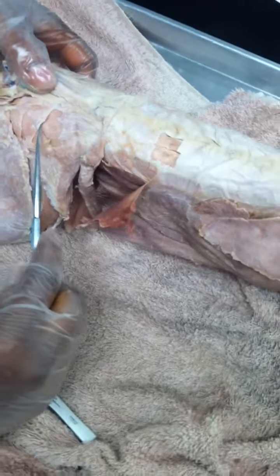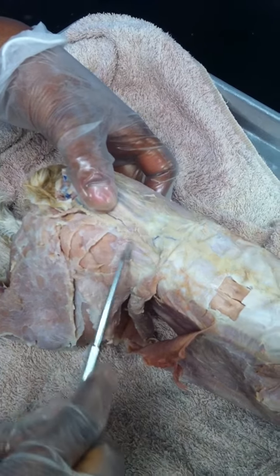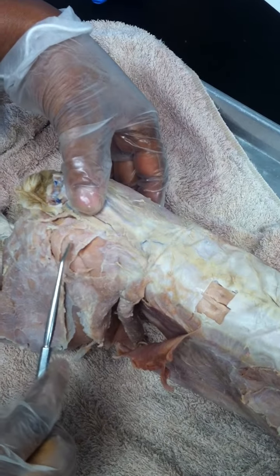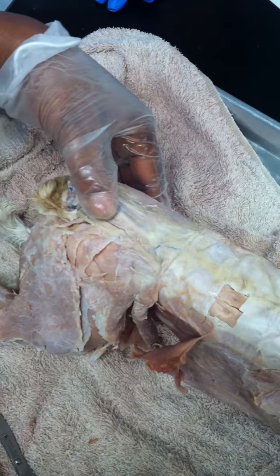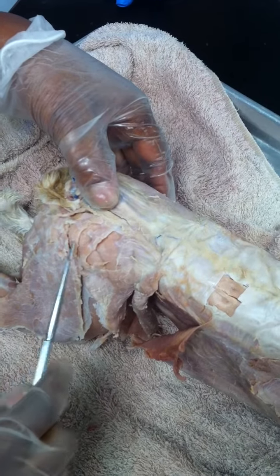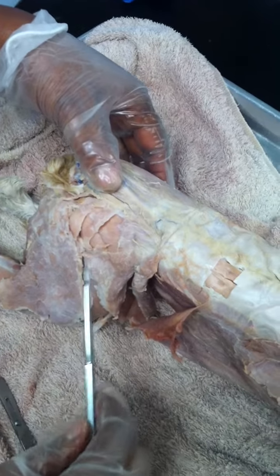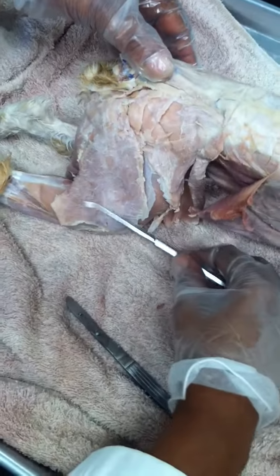Towards the lower back, you have your gluteus. That's your gluteus medius, and gluteus maximus. Gluteus medius is actually bigger, and then gluteus maximus is smaller in the cat. In the human being, the terminology is more consistent, where the gluteus maximus is actually bigger. This one you don't need to know, the muscle underneath gluteus maximus. And then next to that is your biceps femoris. It's a big muscle.